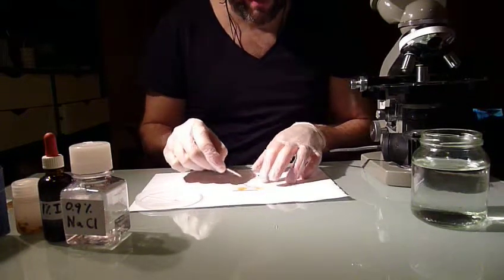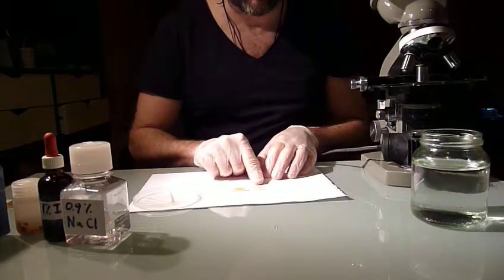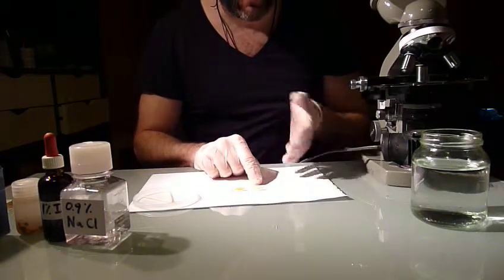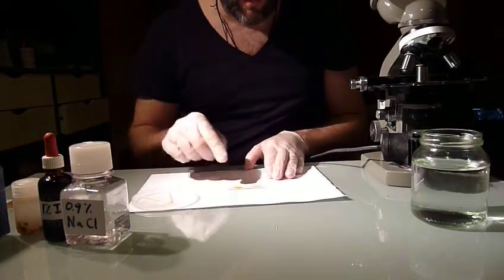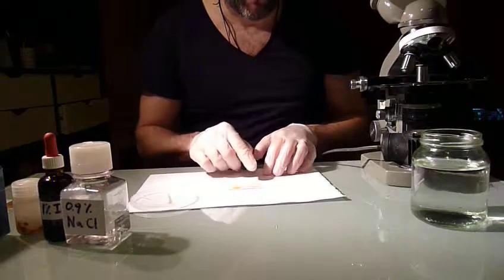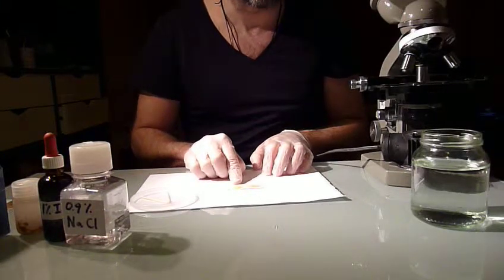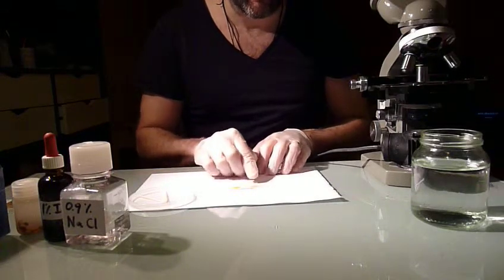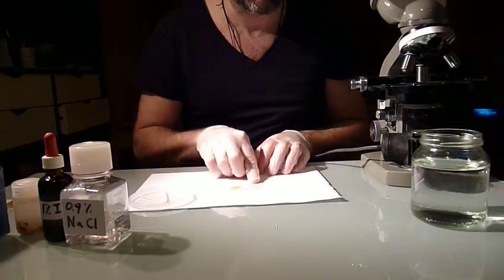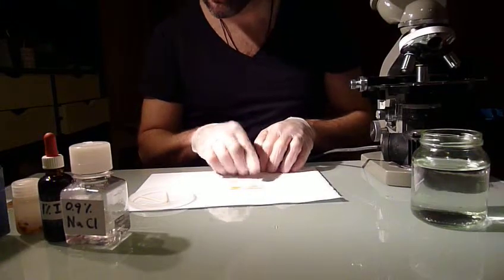And what this will do, it will give you 2 different dilutions. So one with a very high amount of bacteria and cysts, and one with a lower amount. And that's basically a safe option. If there are many cysts, they will be easier to detect in the more dilute sample. If there are a low amount of cysts, you will be able to see them in the more thick sample.